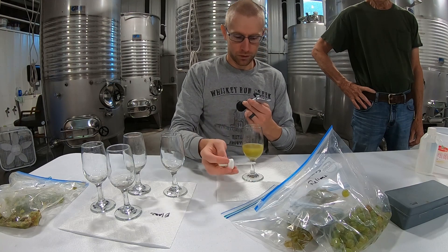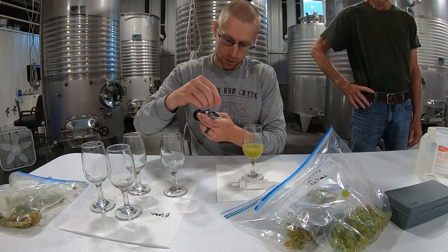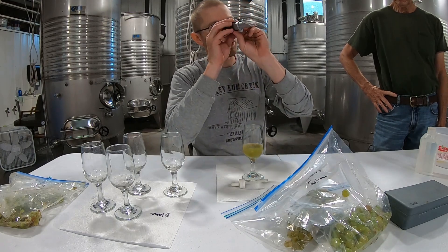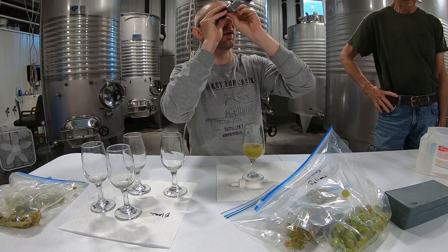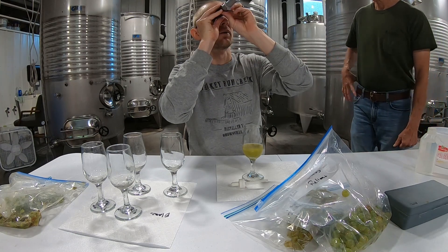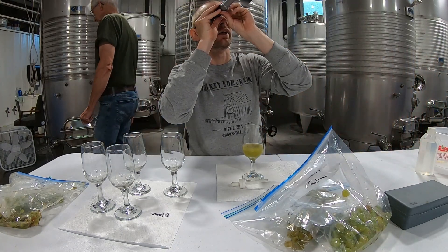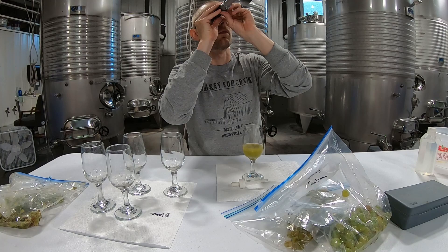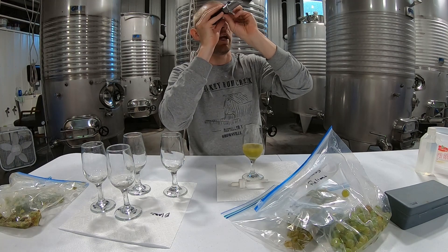You want to put three drops on it, smash it down level, and then look through the eyepiece — make sure you're looking toward a light to make it nice and bright. This one reads at about 17.8.